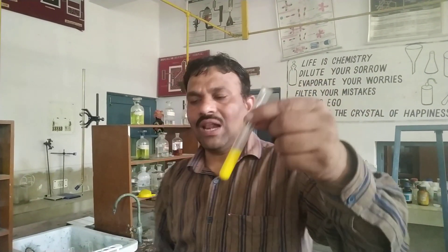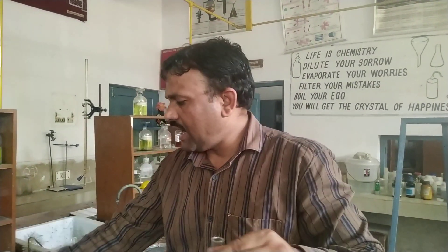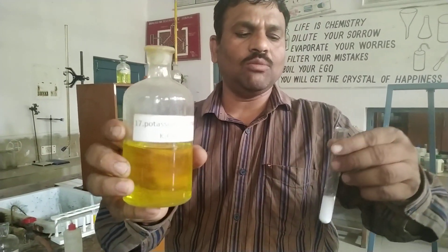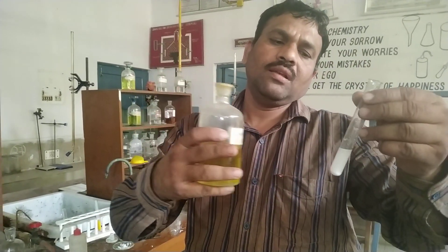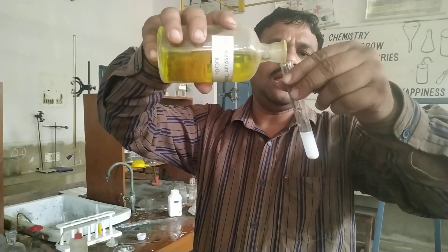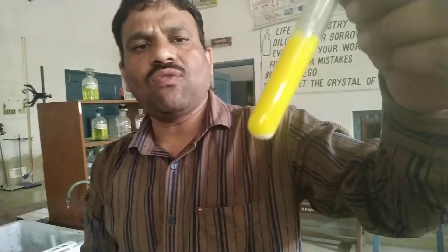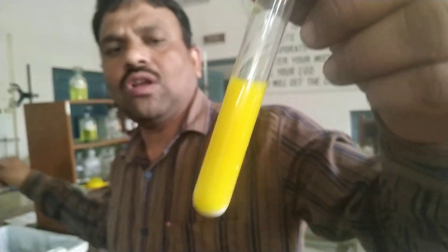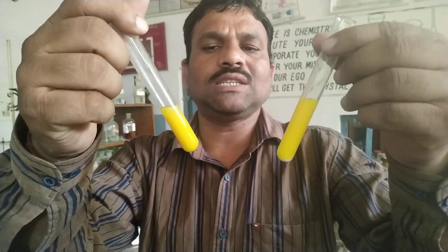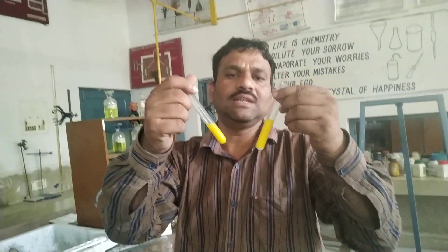Another confirmative test for lead: in the second part where the precipitate was formed, we are adding potassium chromate solution, K2CrO4. On addition of potassium chromate, it forms a yellow precipitate. The formation of yellow precipitate indicates the presence of lead ion. So, on addition of potassium iodide and potassium chromate, we get yellow precipitates, and these two tests confirm that lead ion is present in our salt.